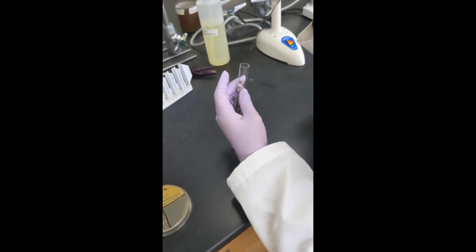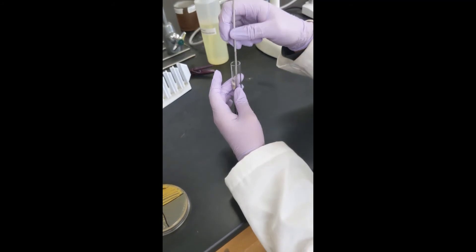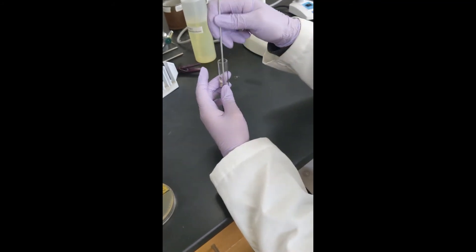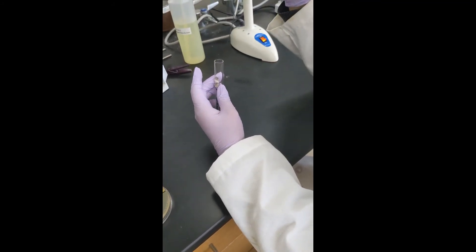You will touch that on the plate and then stick it in your tube. And there you go.